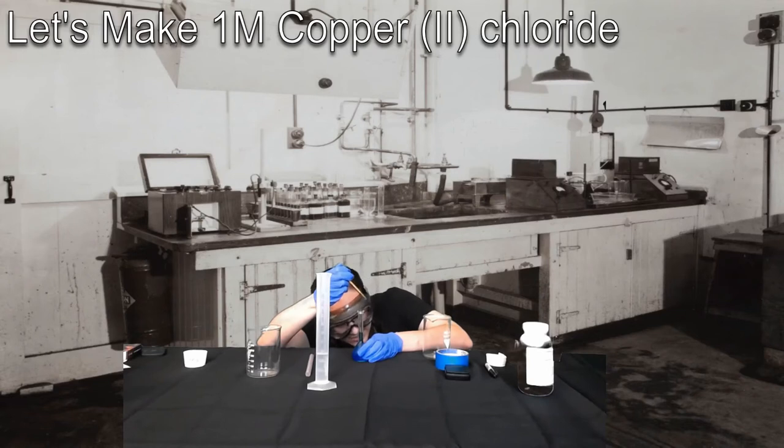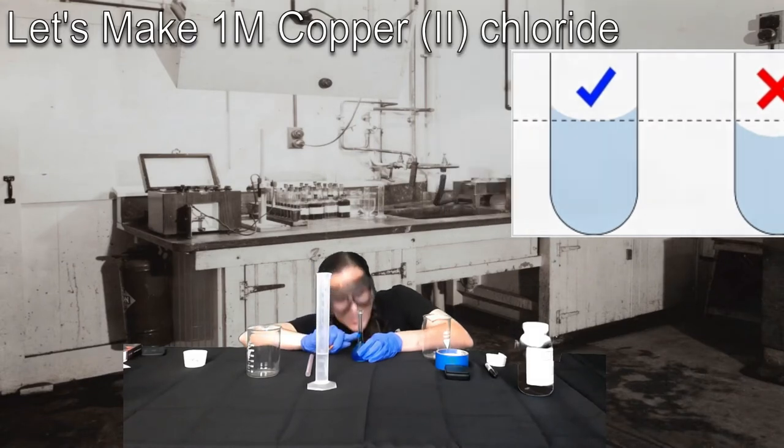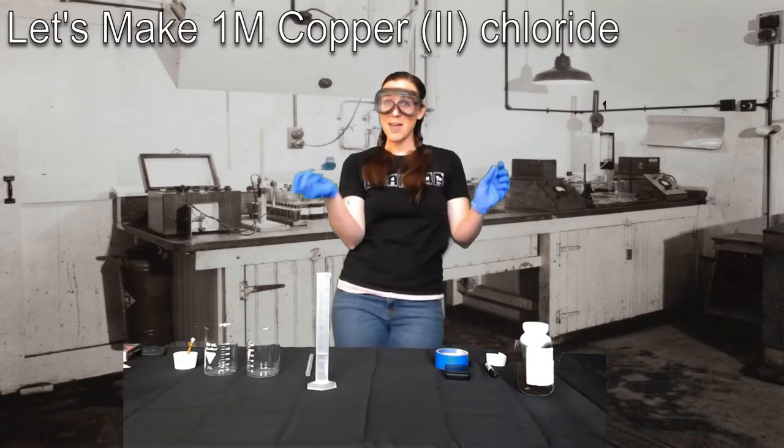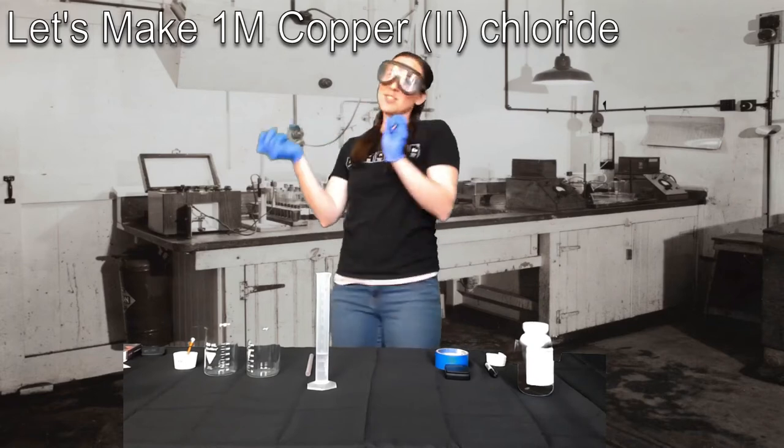So you're going to want to get right down to eye level and add in little tiny drops so you can see where the bottom of the bubble is on the top of that line. Now, of course, the last thing you want to do is shake it up baby now, twist and shout.